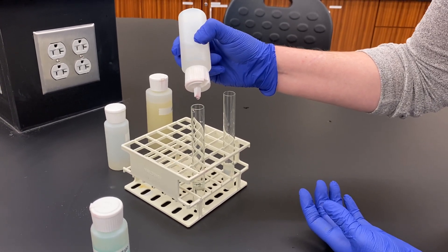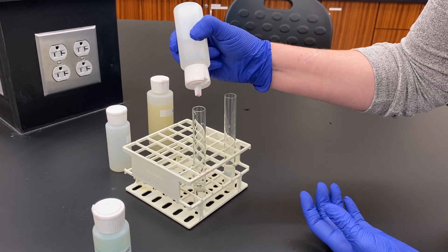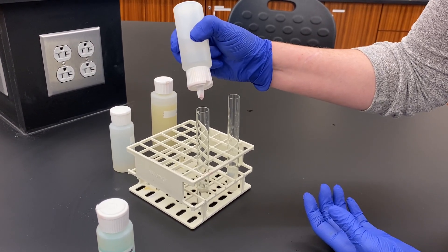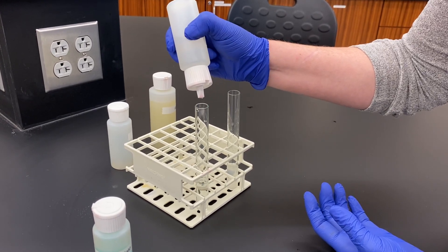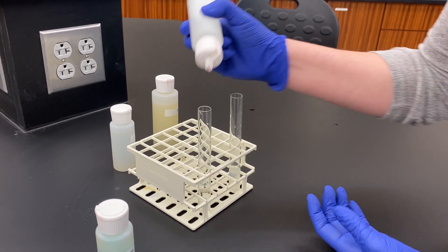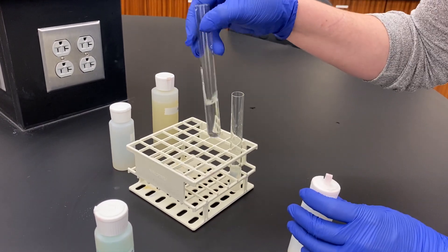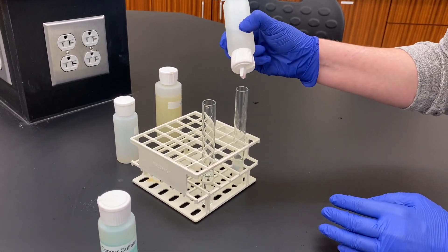1, 2, 3, 4, 5, 6, 7, 8, 9, 10, 11, 12, 13, 14, 15, 16, 17, 18, 19, 20. I'm going to mix that up a little bit. And I'm going to add this also to our positive control.